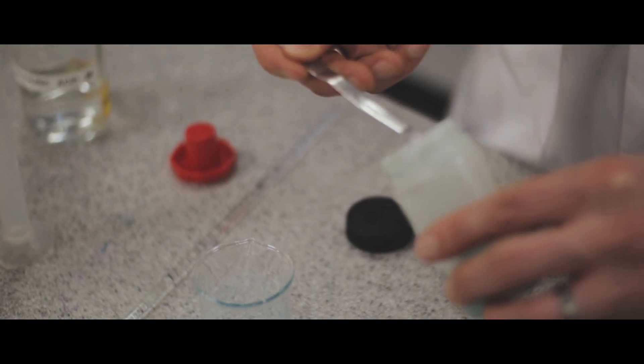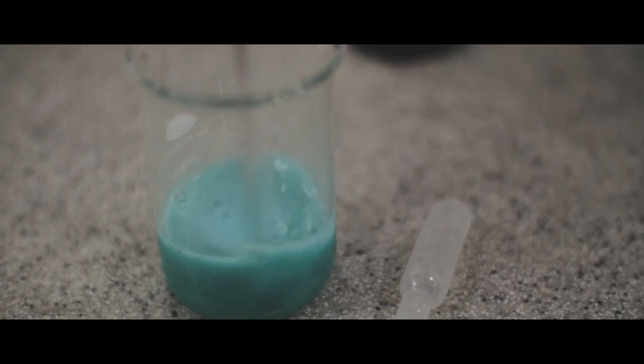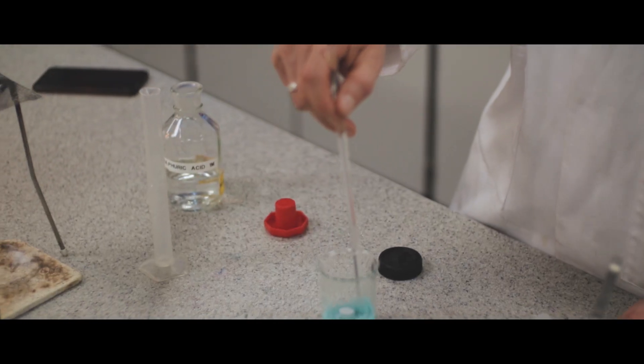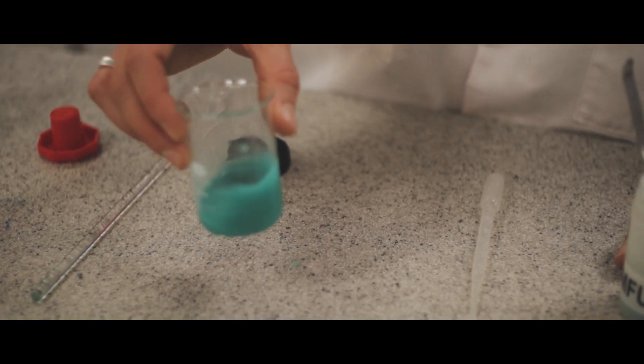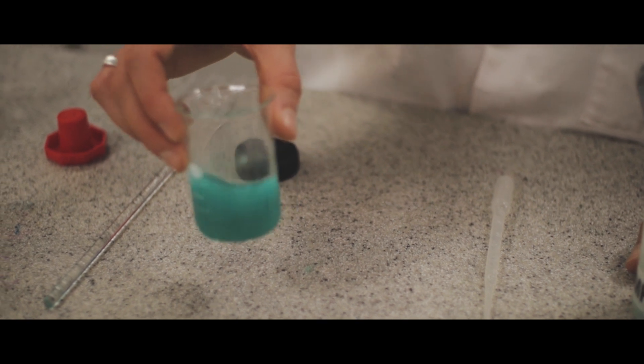Making sure that all of the copper carbonate is reacting. If it stops effervescing, then I can add some more copper carbonate and see if it does it again. There's no more effervescence, so I think I've got excess copper carbonate in here.